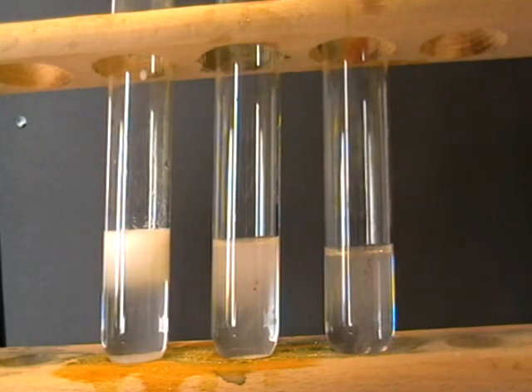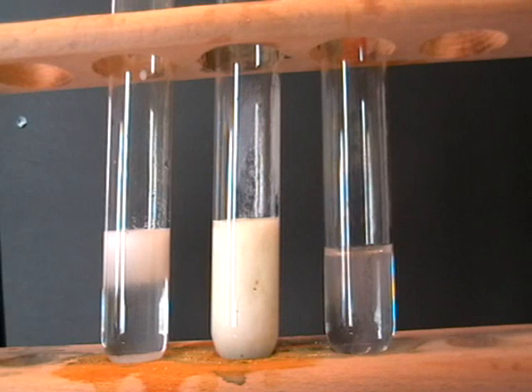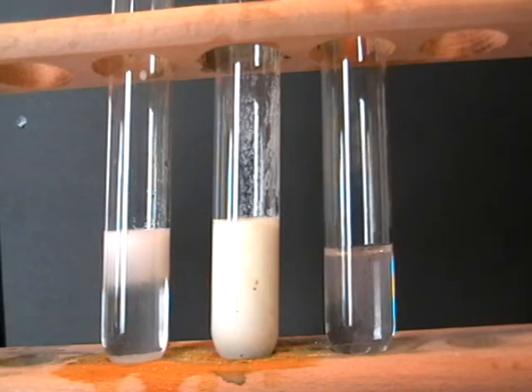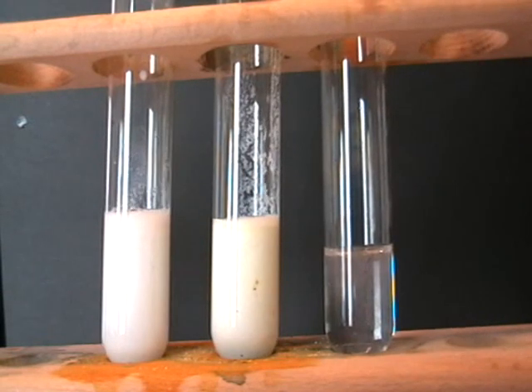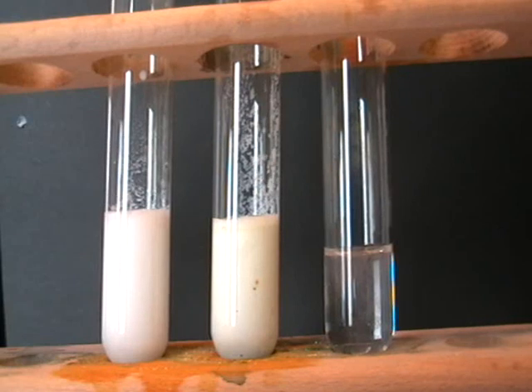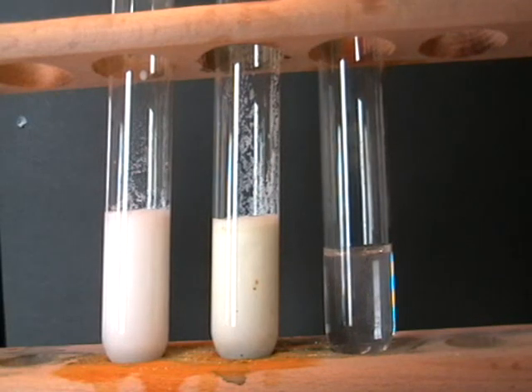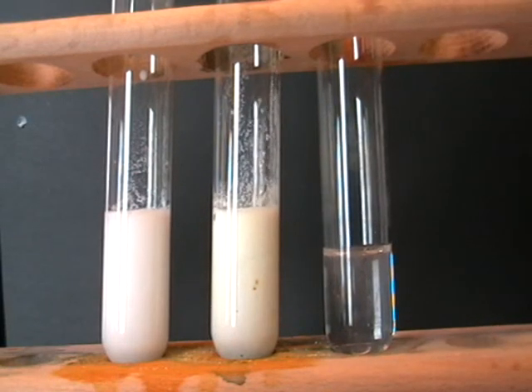Add a few drops to the middle one, which is aqueous sodium bromide. Again, you see a precipitate. You may just be able to make out the difference between the first and second. The first is white, a white precipitate. That's silver chloride that is formed. In the middle here we have a cream or off-white precipitate of silver bromide.